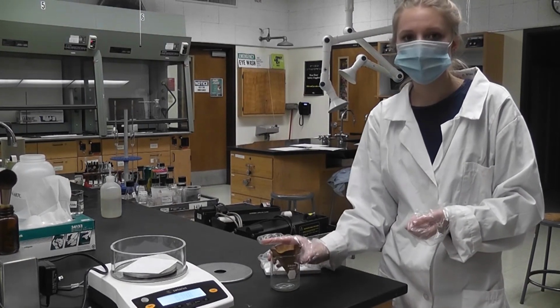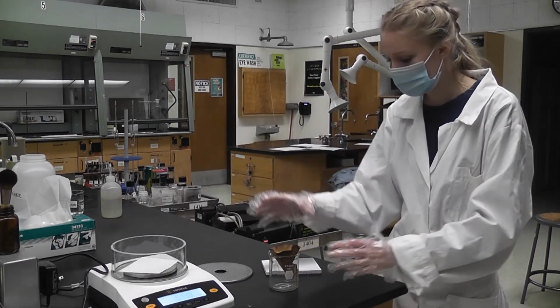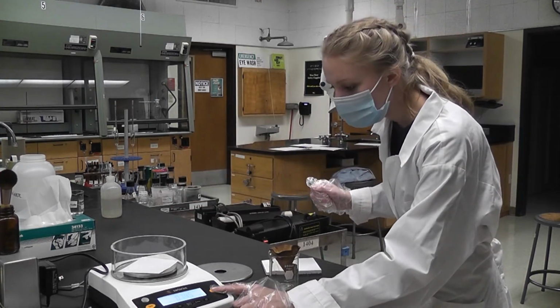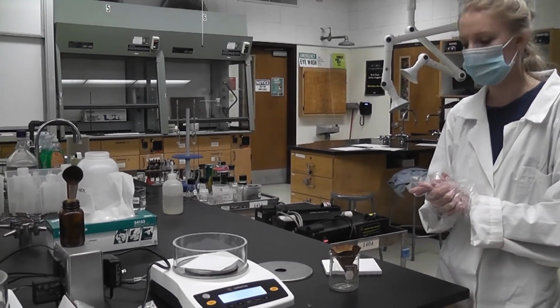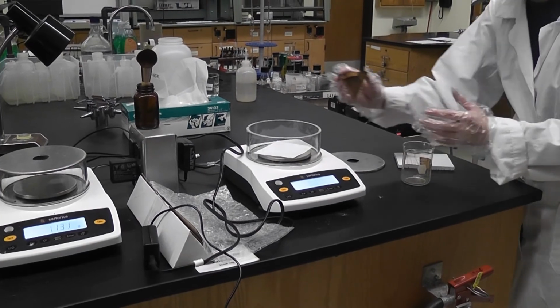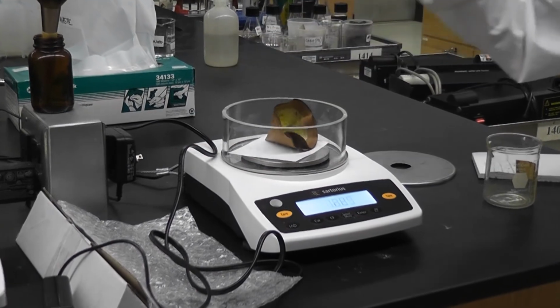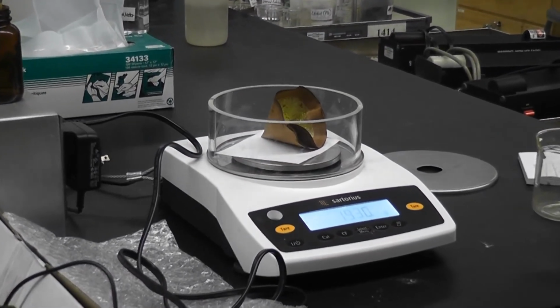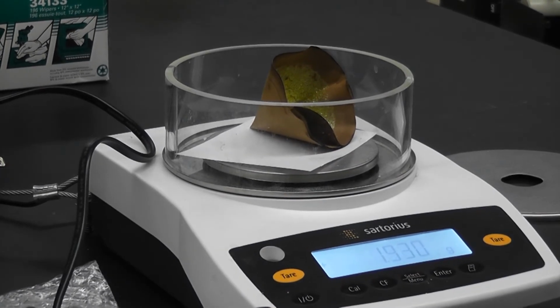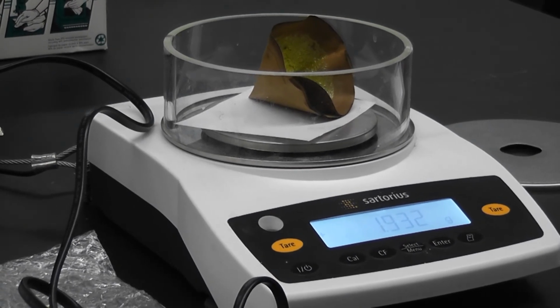Okay, so now it's cooled down to room temperature, so we're ready to weigh it. I put a piece of weighing paper on the balance, so that when I place the filter paper there, it doesn't contaminate or touch the balance. So I'm just going to zero it with the paper on it, so the paper isn't counted in the weighing. And now I'm going to place the filter paper with the precipitate on the paper. Try not to get it on the balance. Doesn't seem to want to balance. Okay. So let it weigh it. Okay. So the weight of the filter paper with the precipitate is 1.932 grams.